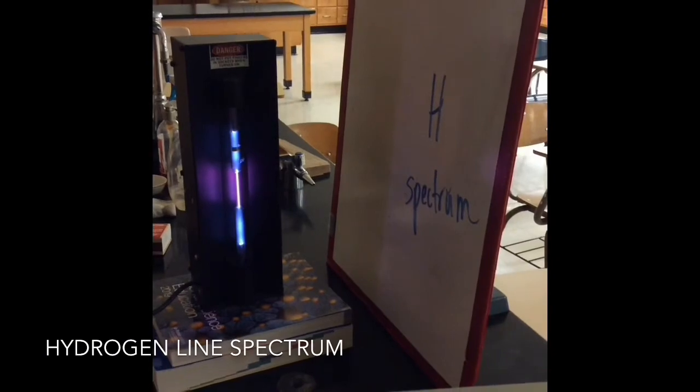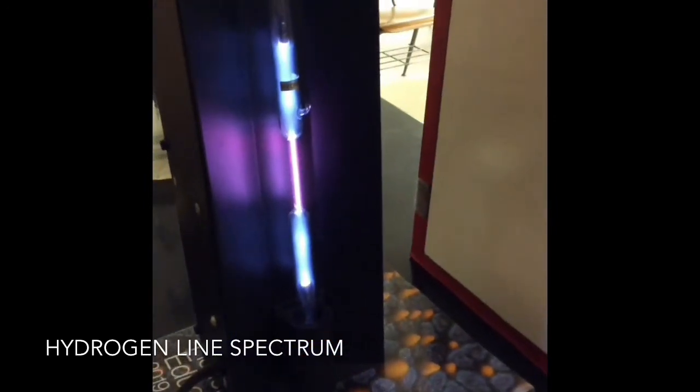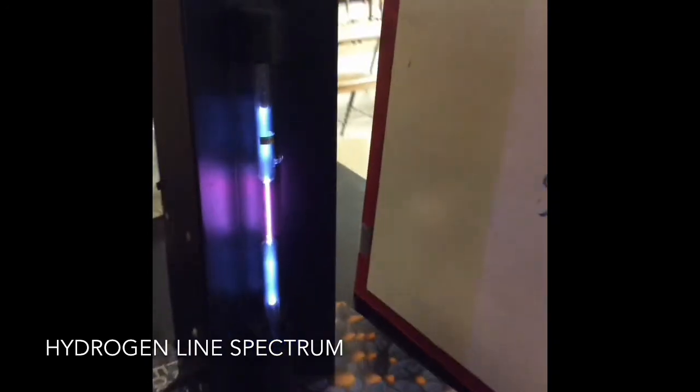Alright, here we have a hydrogen spectrum. So you can see already it's a little different color. Now the camera doesn't really do it justice. If you look at the reflection off the black, that's more what it is. It's kind of a purpley, violet kind of color. And so now let's give you a chance to see what it looks like here. Hang on, give me a chance to get it. There's the spectrum. So again, it's breaking it up.